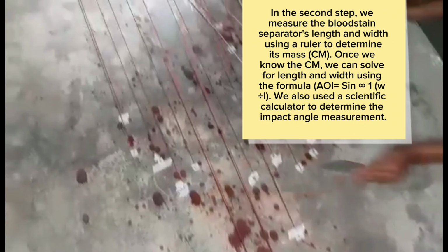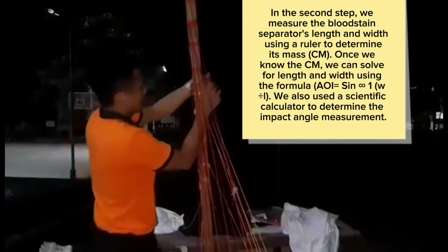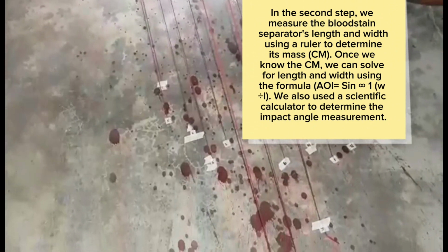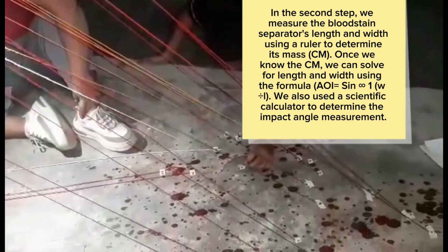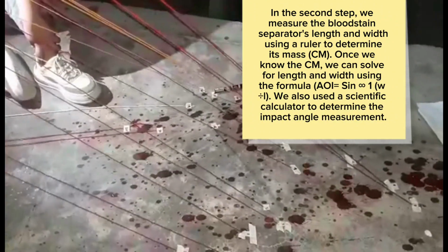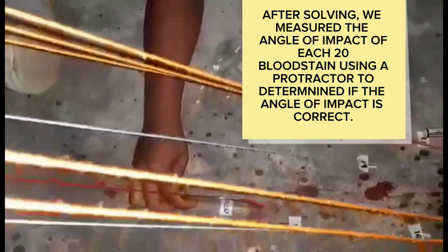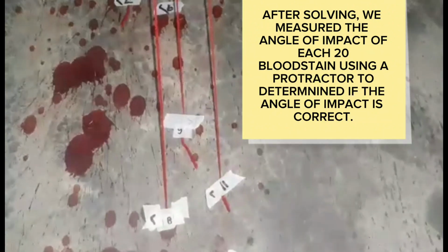In the second step, we measured the bloodstain's length and width using a ruler. Once we know the cm, we can solve for length and width using the formula. We also used a scientific calculator to determine the impact angle measurement. After solving, we measured the angle of impact of each of the 20 bloodstains using a protractor to determine if the angle of impact is correct.